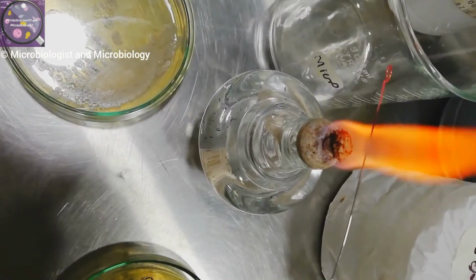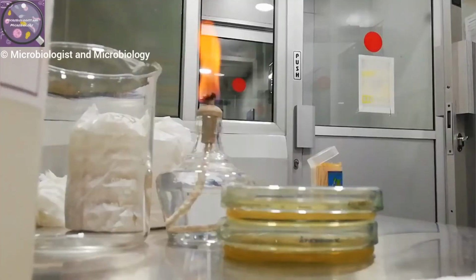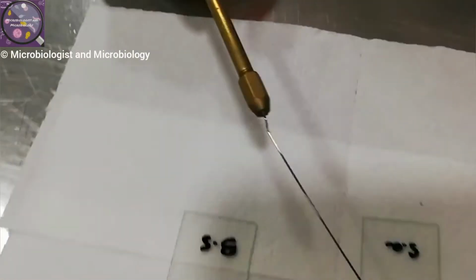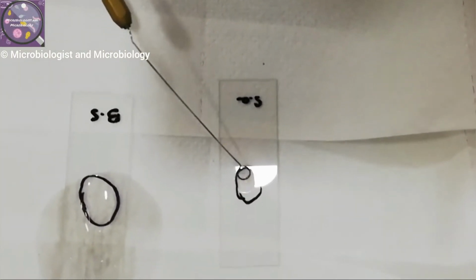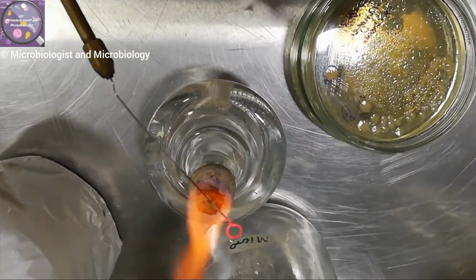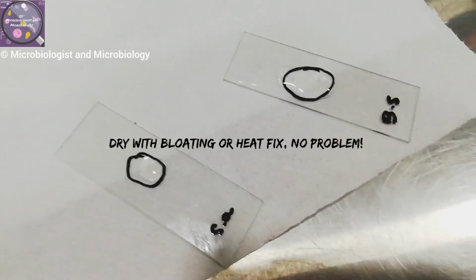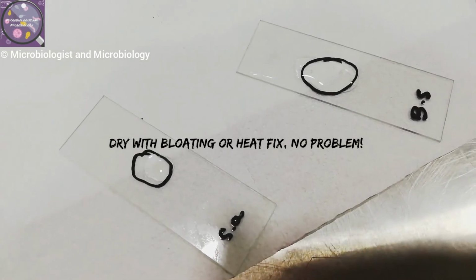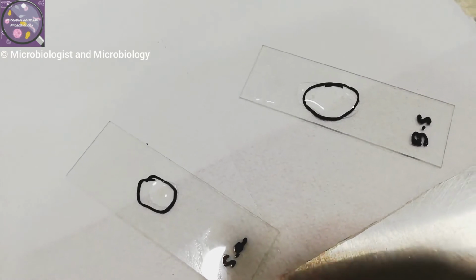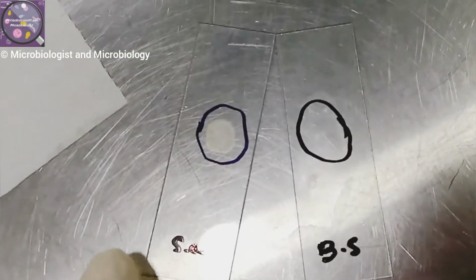Now let me show you how I pick a colony aseptically with the help of a wire loop. Cool it down first, then pick a little colony and put it into the drop of water that we already placed on the slide. Again sterilize your wire loop until it becomes red hot so you do not contaminate by this colony or culture. Let the smear air dry or dry by blotting method. It will take 10 to 15 minutes. You can avoid this distilled water drop step and directly use culture to make a smear by picking up a very little colony, if you can. So both my slides are ready for gram staining.